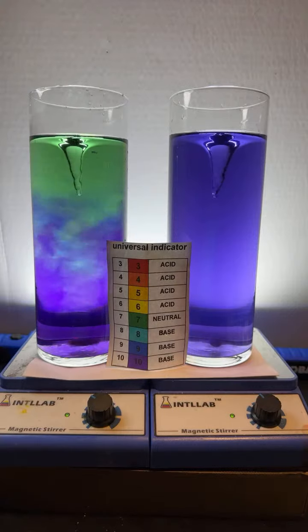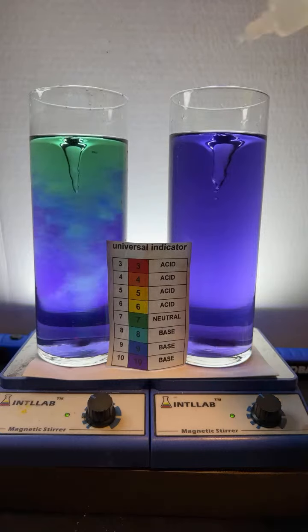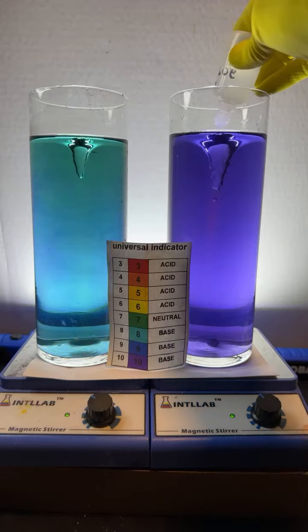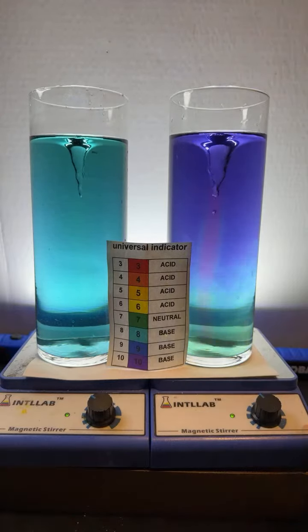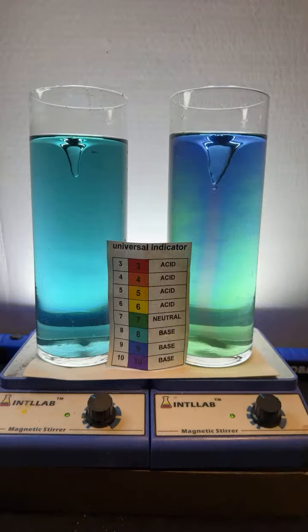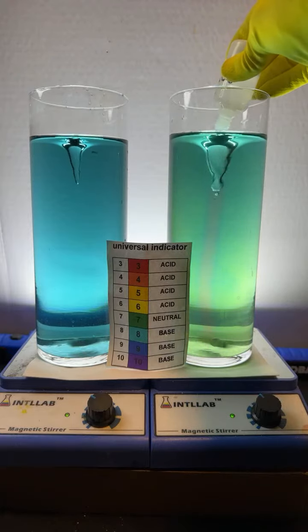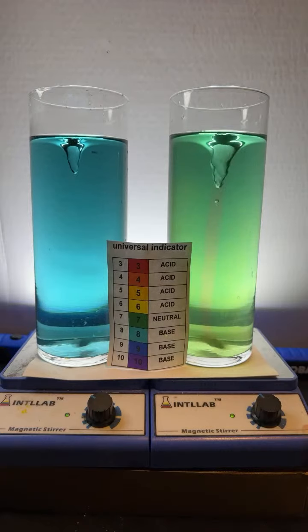The reason it does that is because the center has low pressure. The center of the vortex is a low pressure system, and material moves from high pressure to low pressure. So the material that I'm adding, since it's in the center, in a low pressure region, is going to tend to stay there. So you see I've added acid. I'm adding acid to the center here, and you can see that red line kind of stays there, again, until it hits the bottom and gets pushed out along the sides.